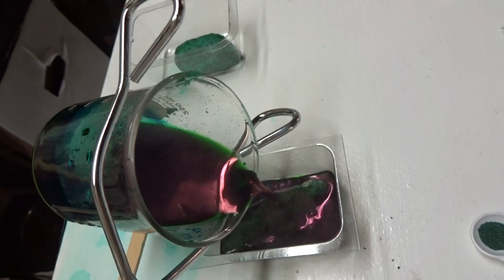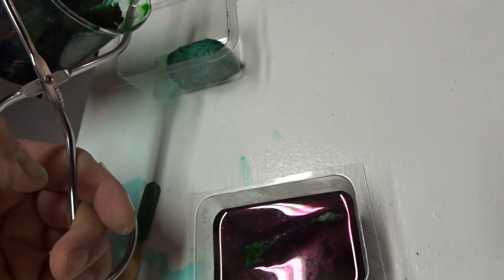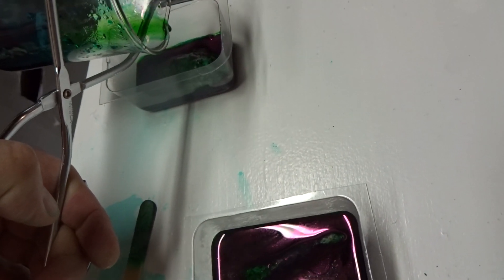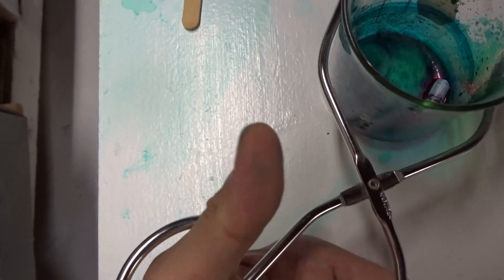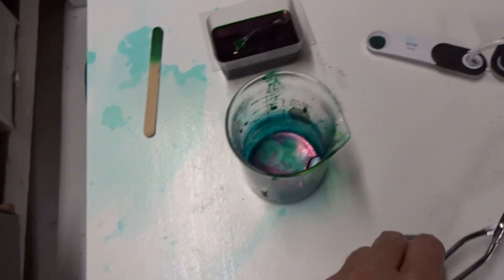Three-fourths from the top. Here we go. Add the remainder to this. I want to see if there's any solid material. No, it looks like we got it all. Very good. Almost all — I see some... let's see what we got.